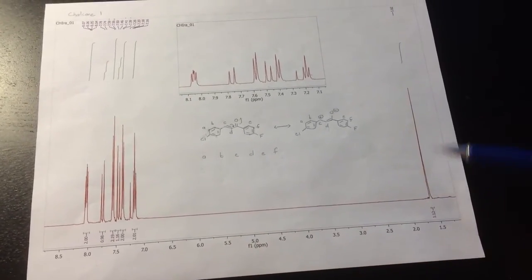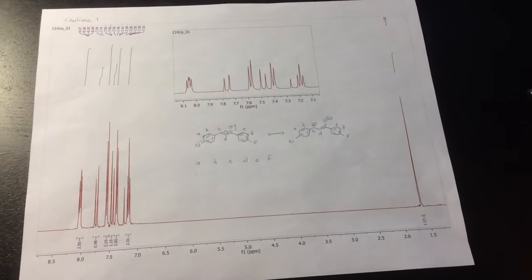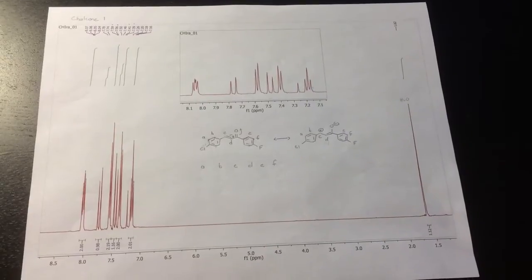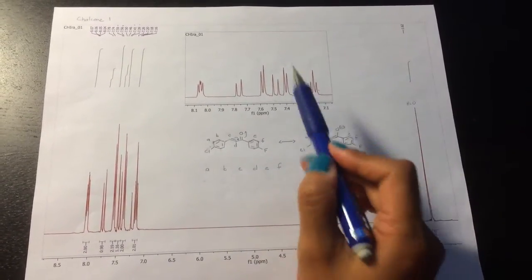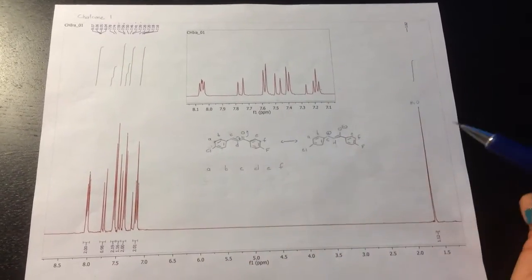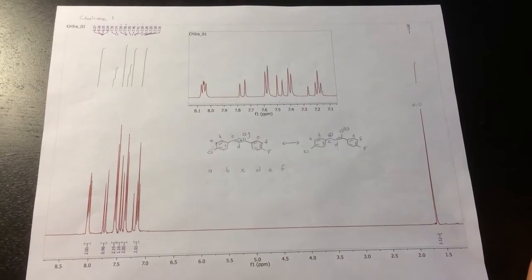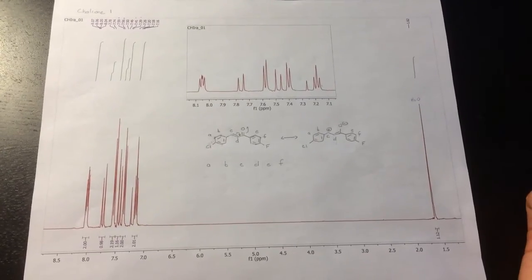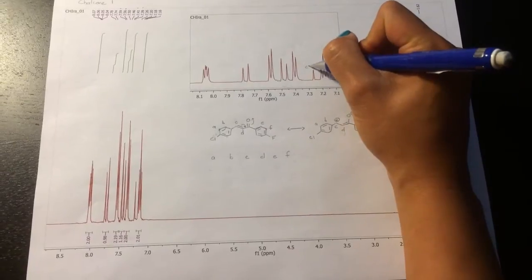We do see a peak that's up here at 1.62, and the reason for that is because that actually belongs to trace water that's in your sample. So that ends up being water that's there. This inset that you see here is actually just a blown up region of what you see here, just so you can see the splitting. The one peak that you will always be able to assign right away is the NMR solvent that the sample was run in, and that is deuterated chloroform in this case, and that shows up at 7.26, and so that's right here.